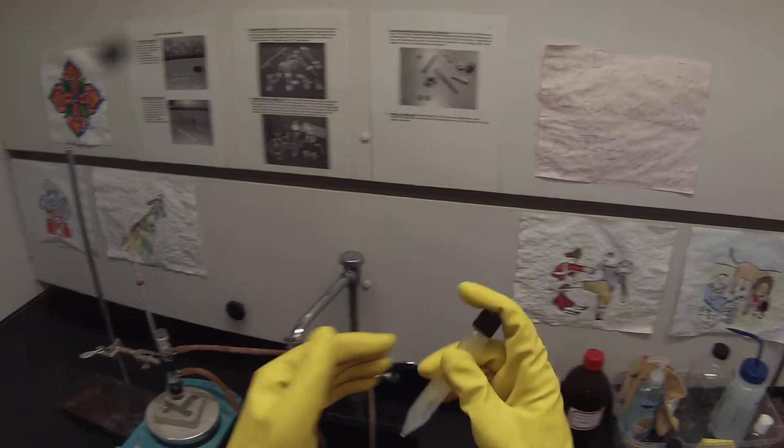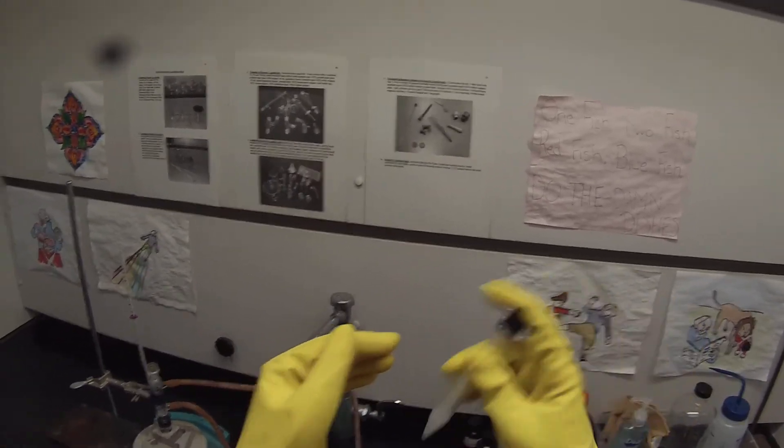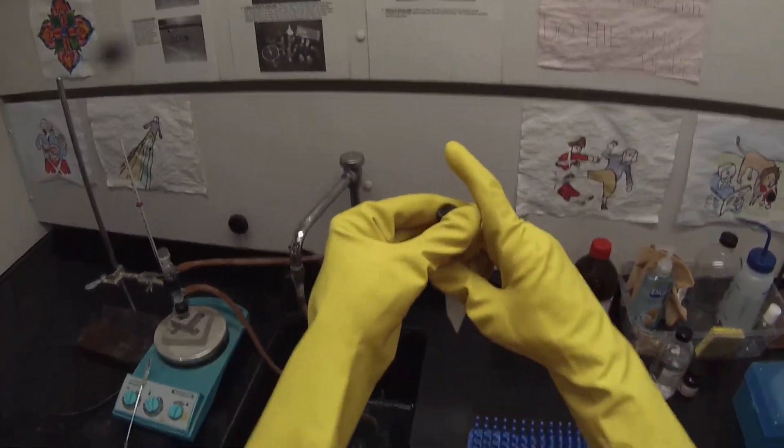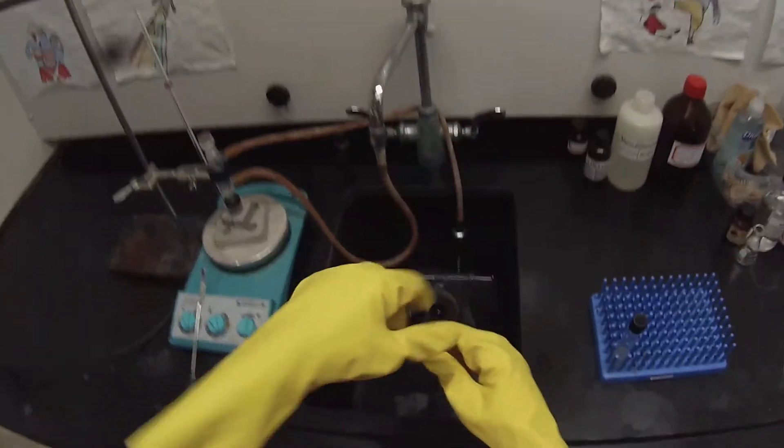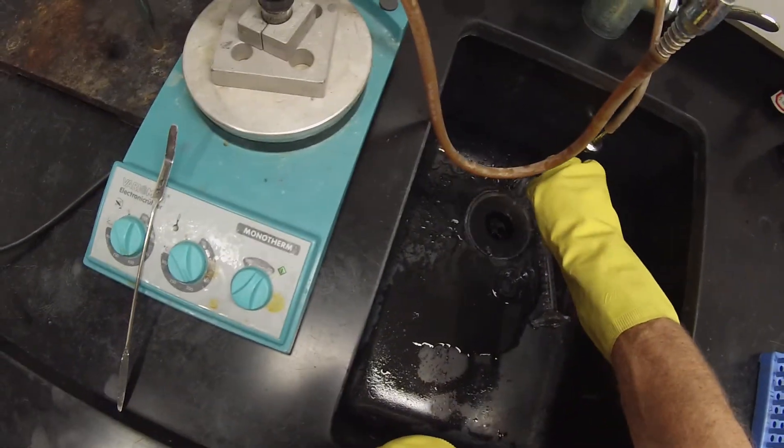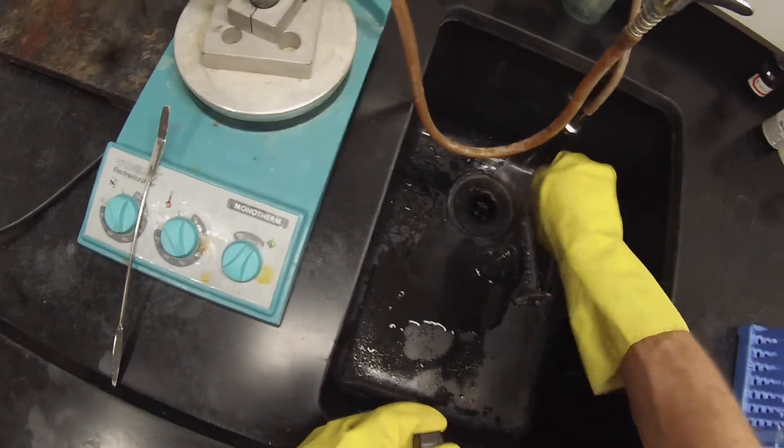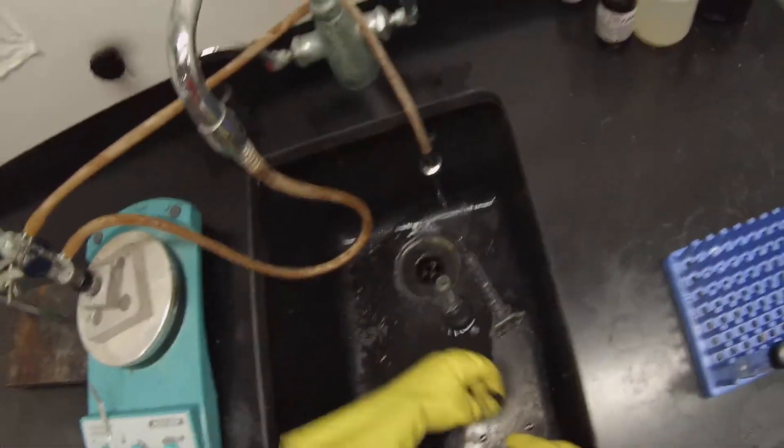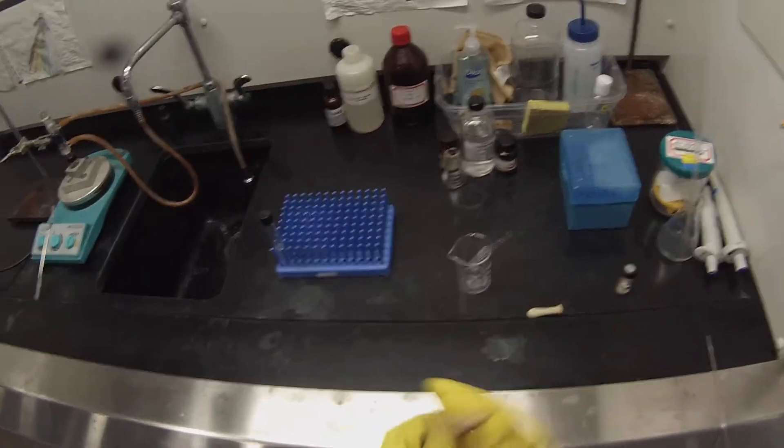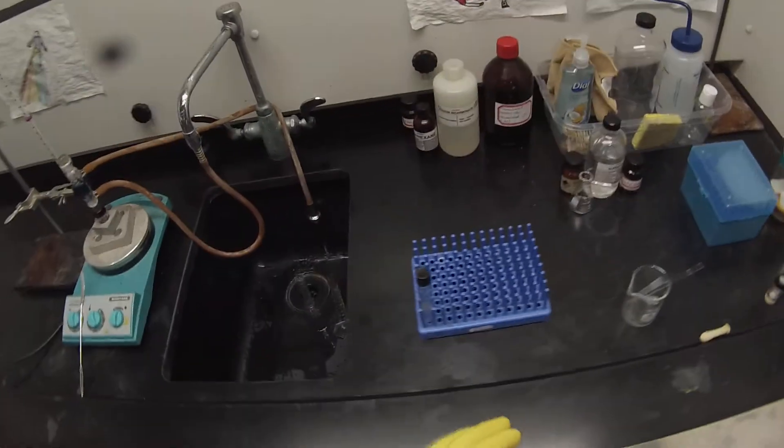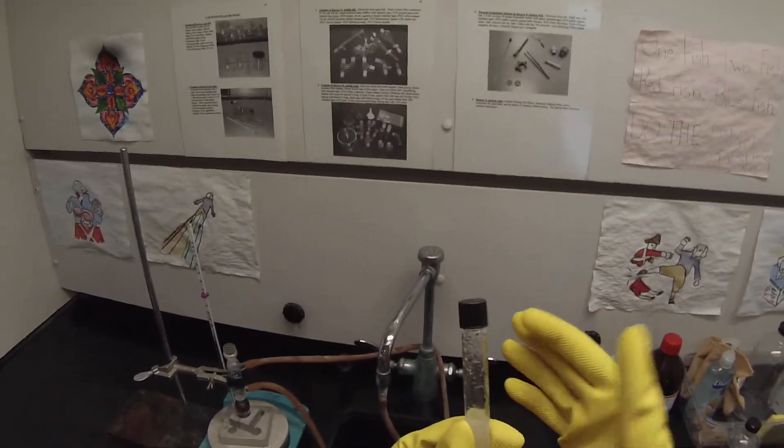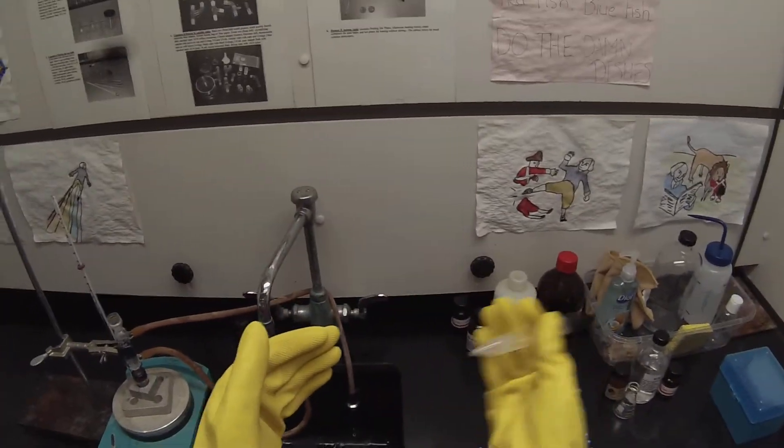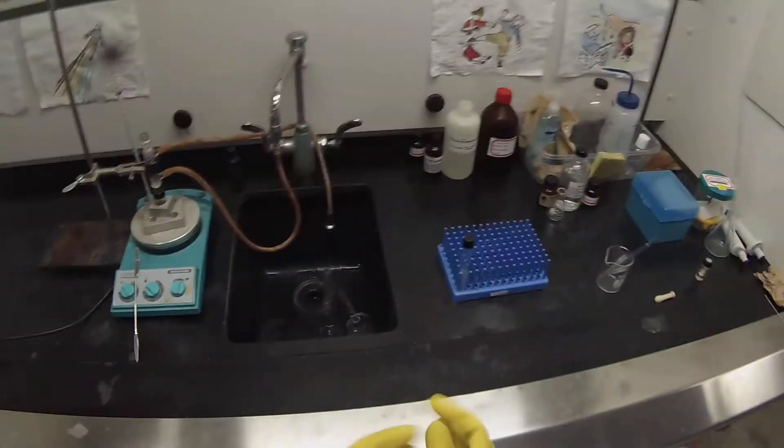This is the one that we're letting go too long. So I'm going to shake this some more and vent it. I'm just going to let this thing sit for quite a while. Periodically shake it to mix it and let it vent. This extra acid can get dumped down the sink. Plenty of water. Set that centrifuge tube in there. So we'll shake that again. Looks like it's not leaking so I could probably take the gloves off. And we're still at 140 so we've actually achieved our equilibrium on this n-butanol reaction so that's pretty good.